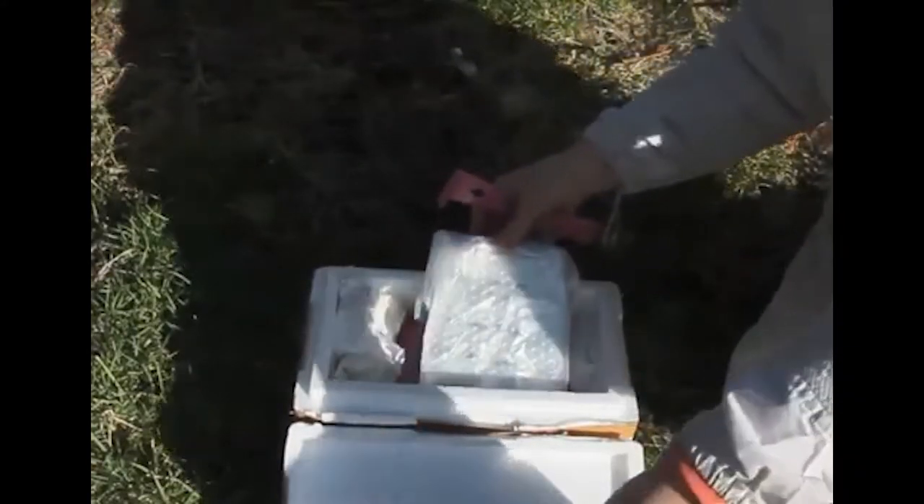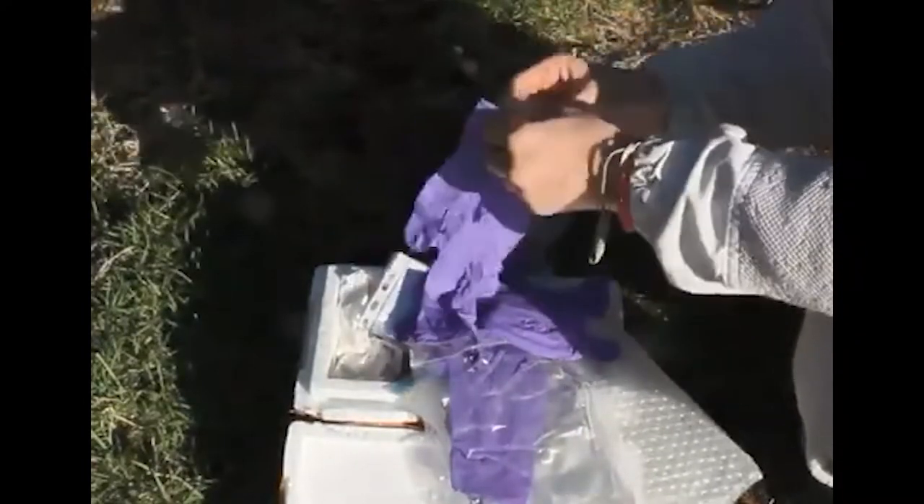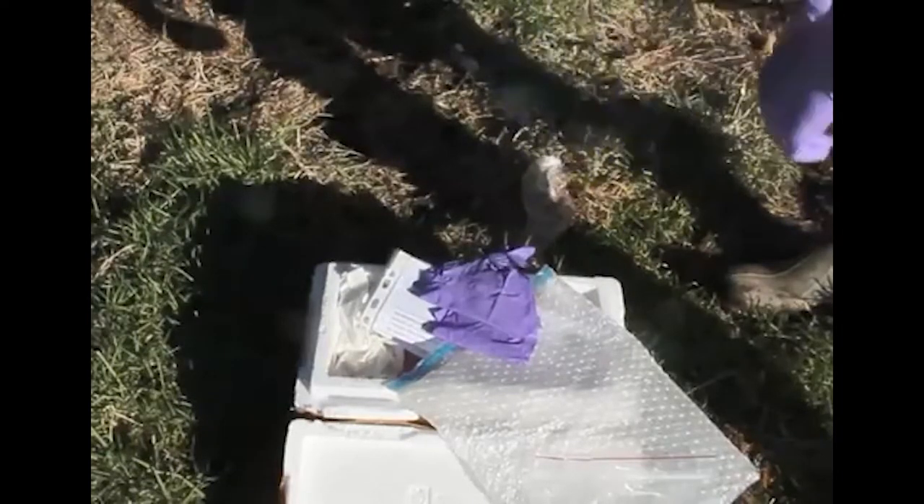The samplers came with ice packs in a polystyrene packet, as you can see here, and a set of instructions that must be followed. The first part of the instructions was that you had to put on two pairs of gloves and not cross-contaminate the samplers, so the second pair must be disposed of when you go to do the second stock of bees and put in the second sampler.